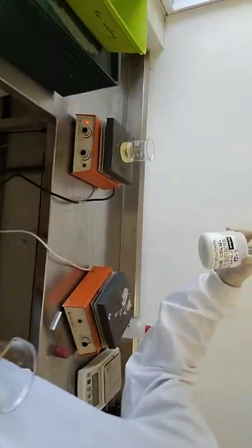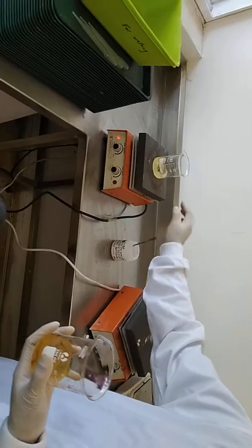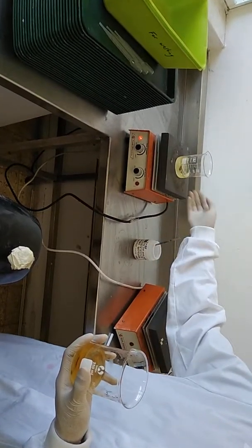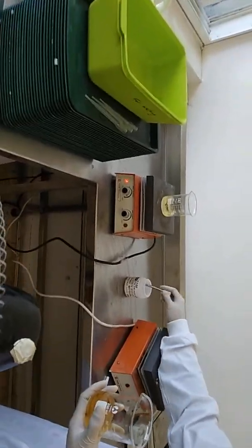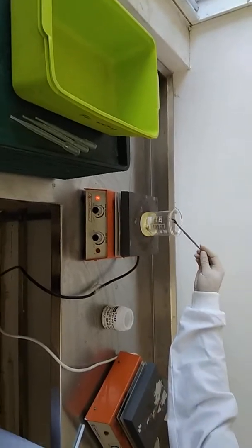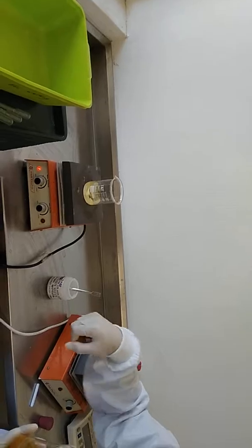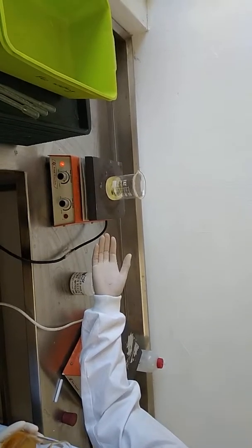like this. After that, I put in some drying agent, some solid, to dry it. In this case, I use magnesium sulfate, and I got help from the magnetic stirrer, so it's helping me to dissolve it much faster. Okay, I just put in a little bit and let it spin, so that the solid would absorb all the water in the ester. And then I got a pure ester.